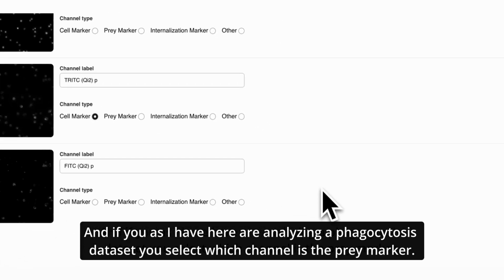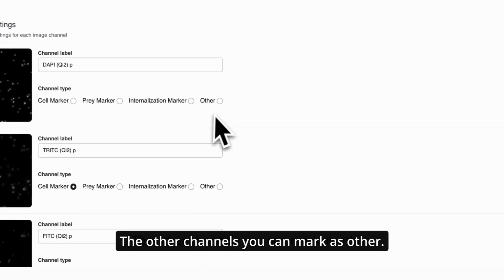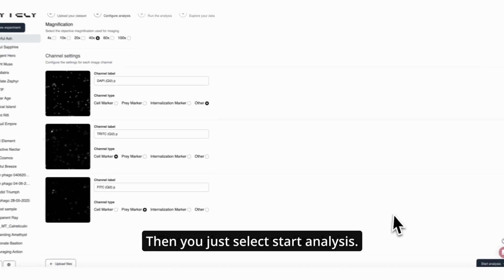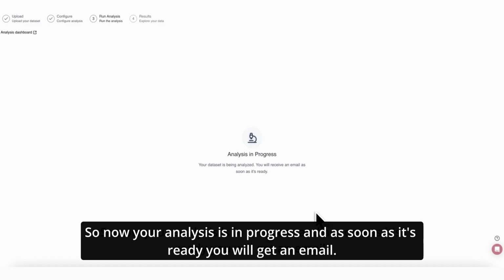And if you, as I have here, are analyzing a phagocytosis dataset, you select which channel is the prey marker. And if you have an internalization marker, you select it here. The other channels you can mark as other. Then you just select Start Analysis. So now your analysis is in progress, and as soon as it's ready, you will get an email.